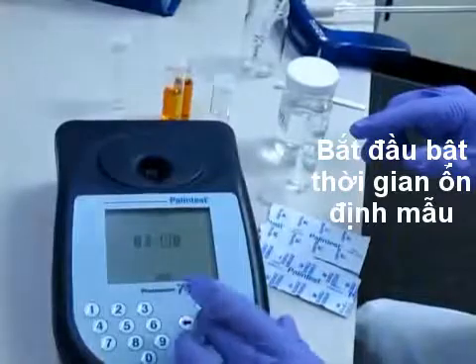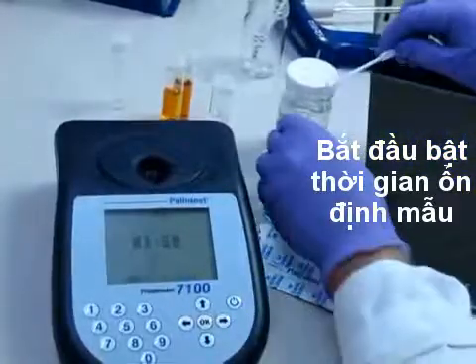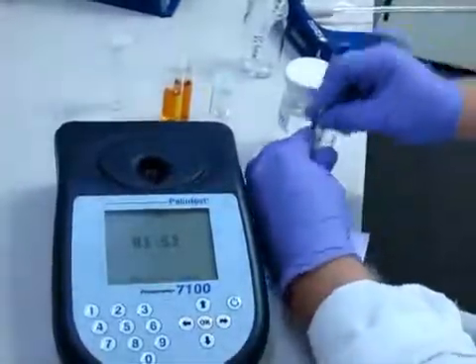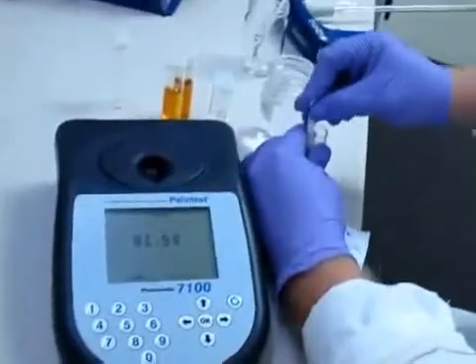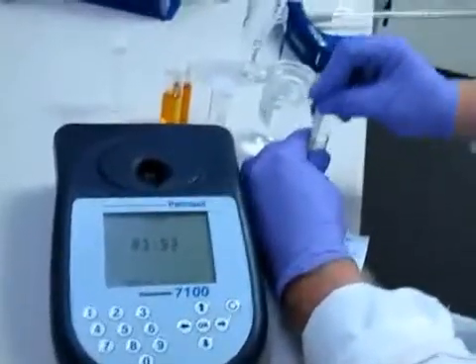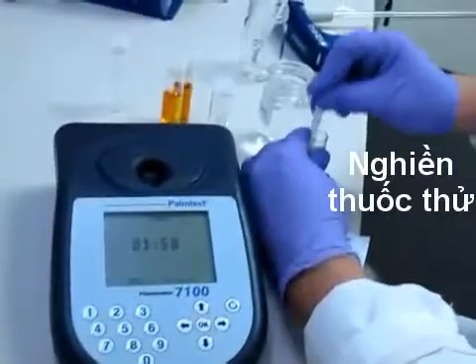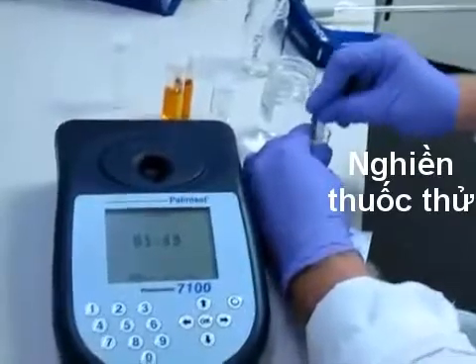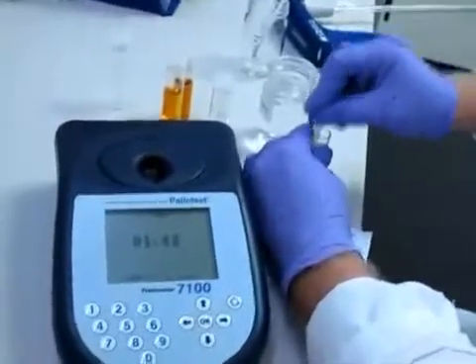Hit ok and start crushing the tablets with the pestle. Color formation is pretty immediate. Takes two minutes for full development.